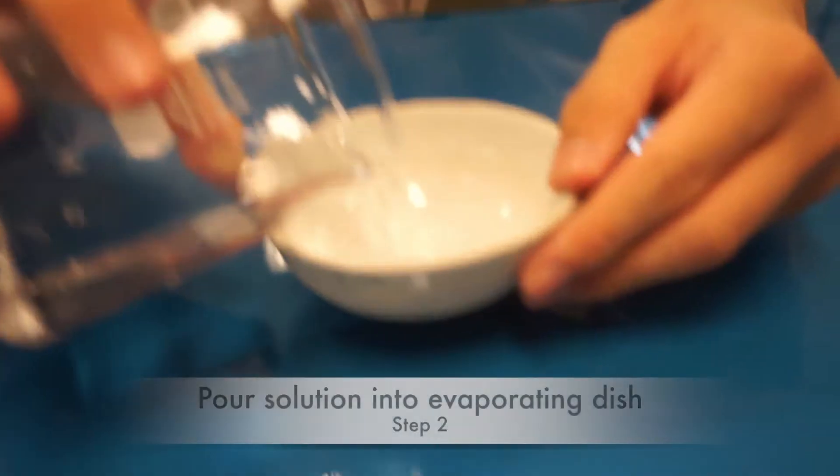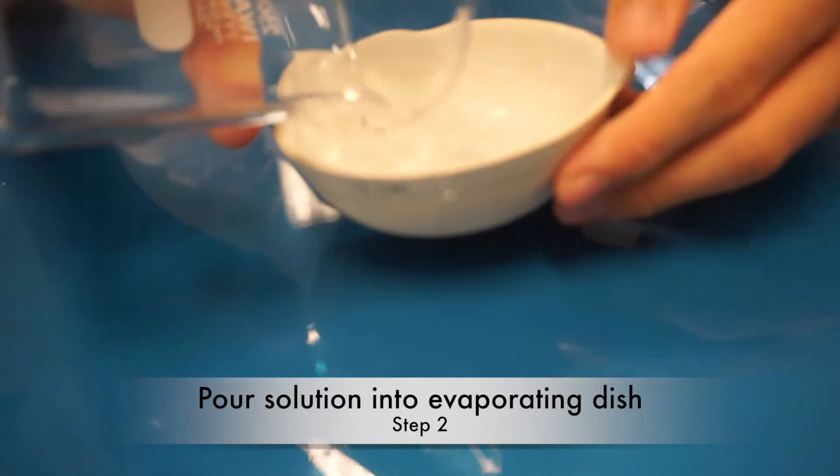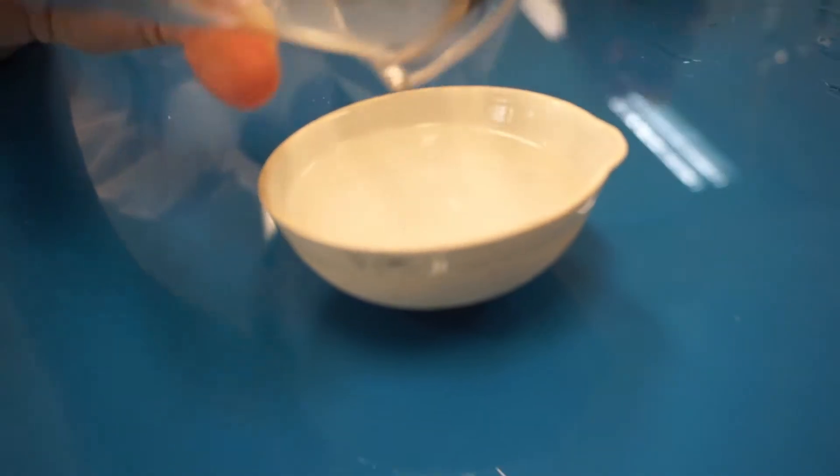As you can see, all the salt has been dissolved. Now it's time to pour the solution into the evaporating dish for evaporation.